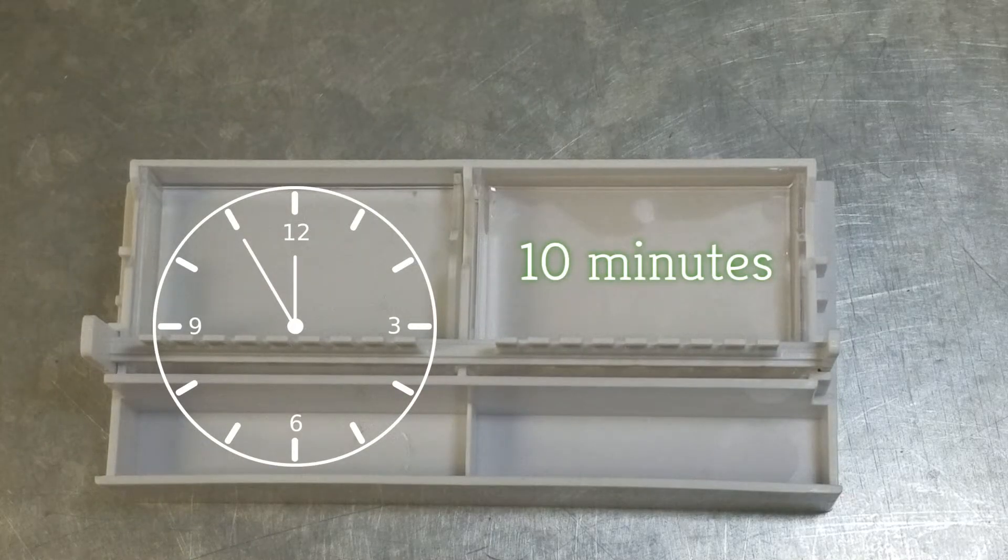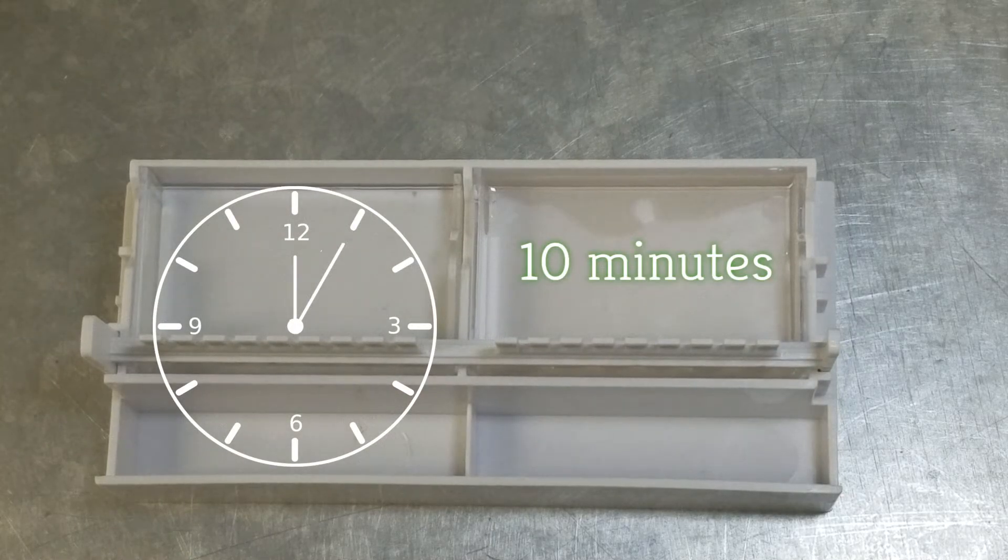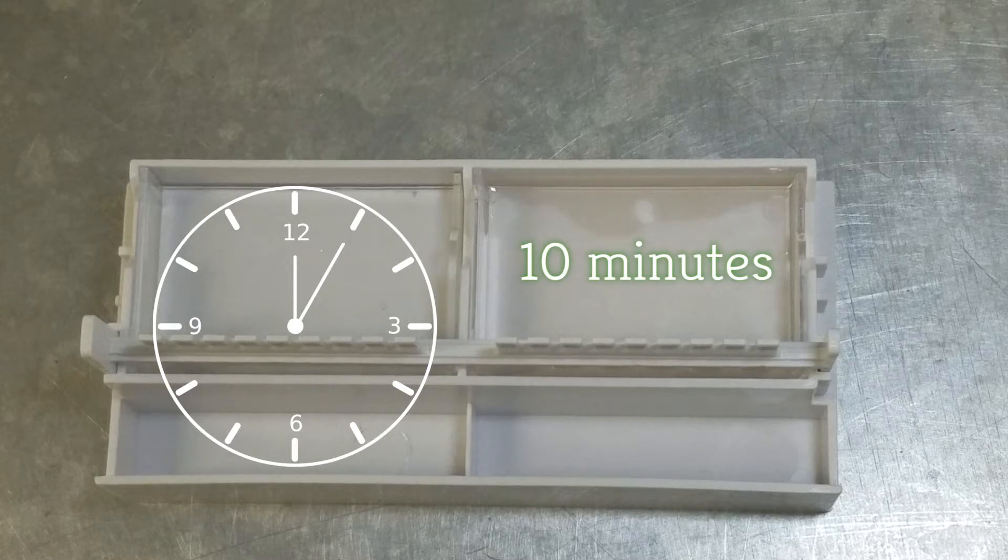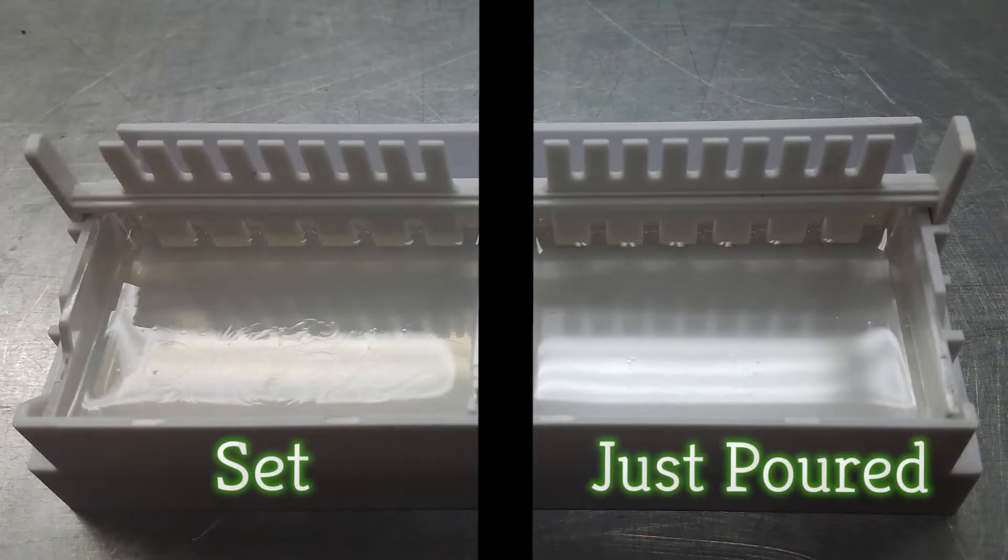Leave undisturbed for at least 10 minutes to allow the agarose to set up and solidify properly. Double check to make sure that the gel has completely solidified. Look to see that the agarose, which used to be completely clear, is now more opaque or cloudy looking.